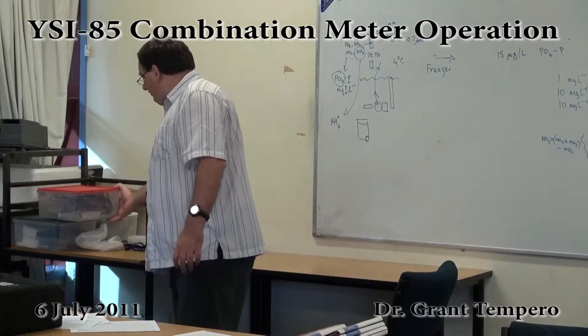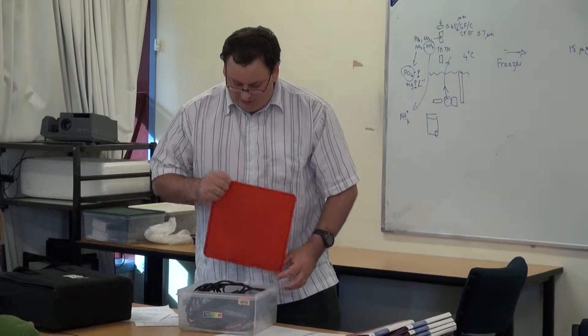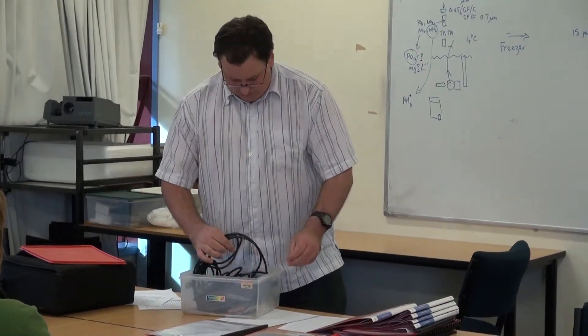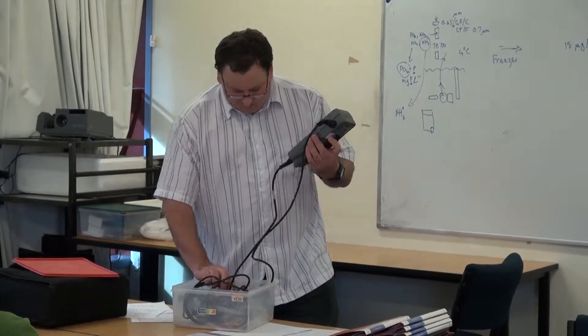And the last one I've got is the YSI 85. Oh, okay, someone's put this away wet. It shouldn't be done, it should be drying these off.